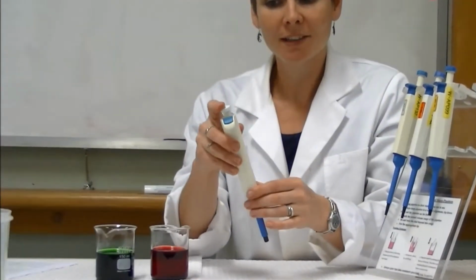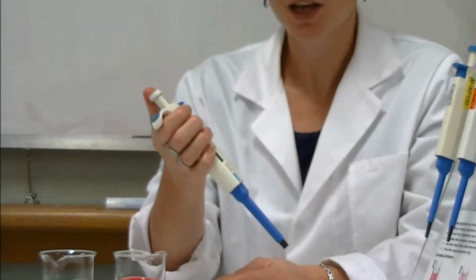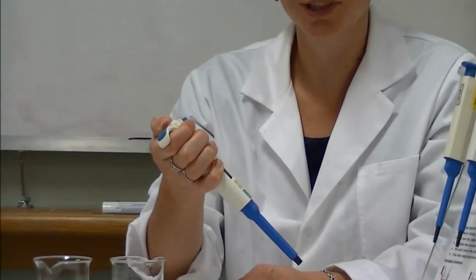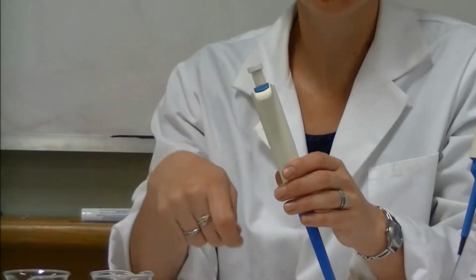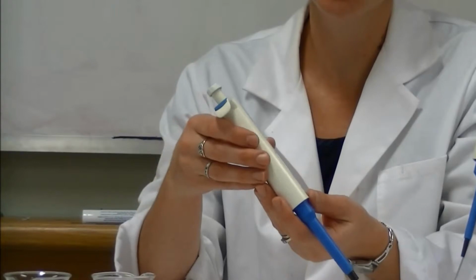The first thing is the plunger here. So you'll notice when you pick it up that there are two stops. The first stop and the second stop when you press it down. The first stop allows fluid to be drawn into the pipette, and the second stop makes sure that all the solution is expelled from the pipette tip.